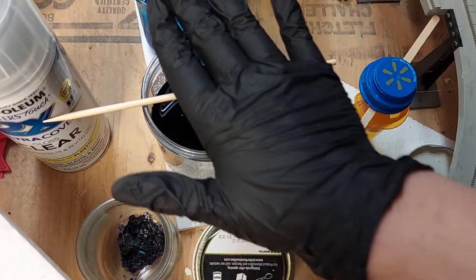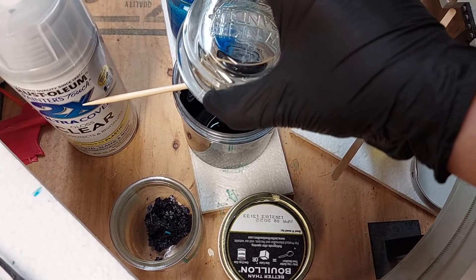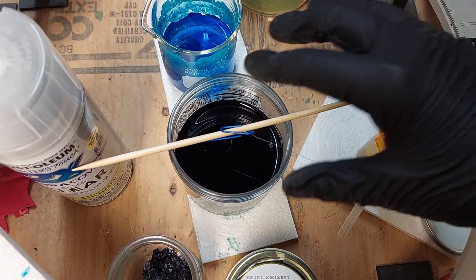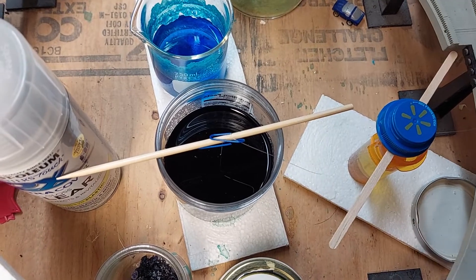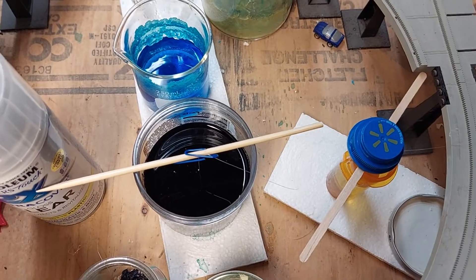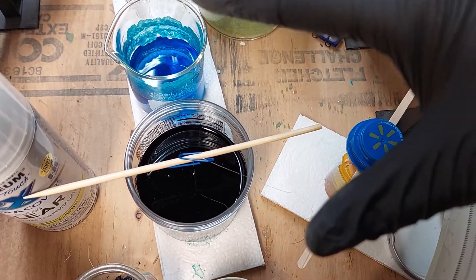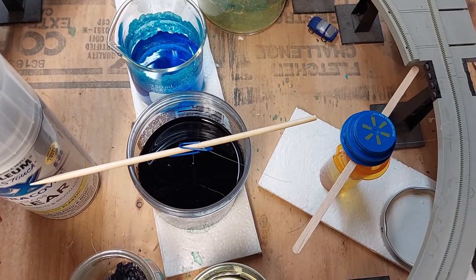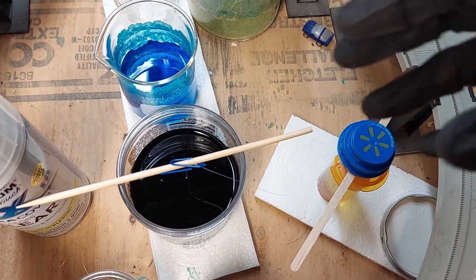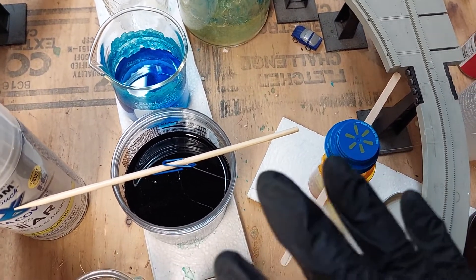I like to put a little lid on top and gradually increase the opening over time so the crystal grows at a controlled rate. You want to grow your crystals in an area free of disturbances — not just sound, but anything that might disturb the crystal: light, vibrations, dust. You want an isolated area with a stable temperature and just allow the water to evaporate.